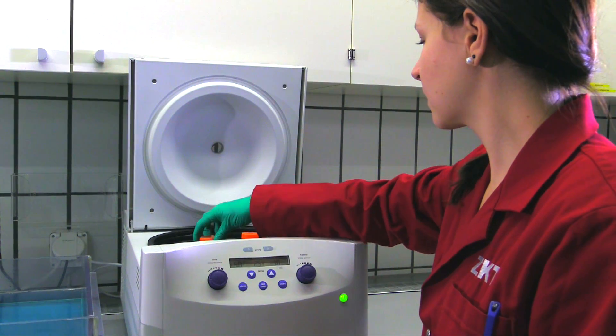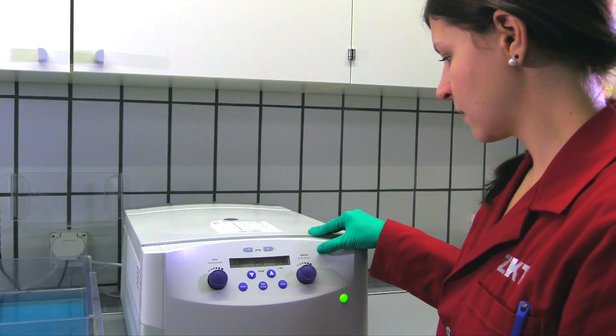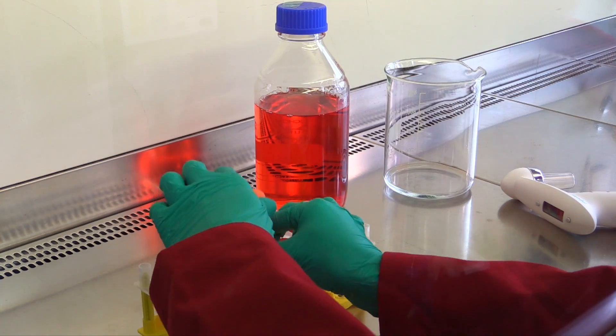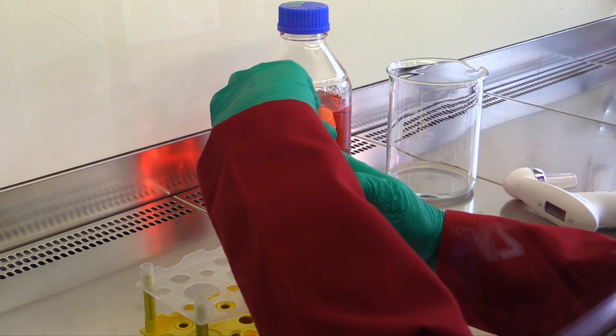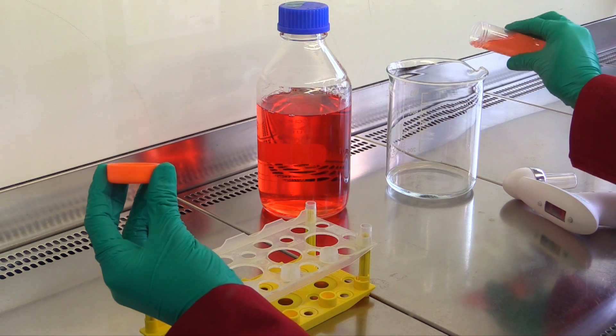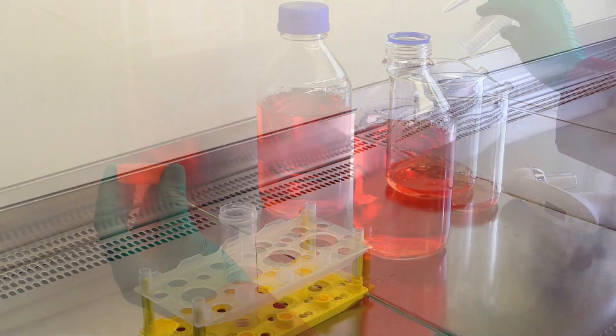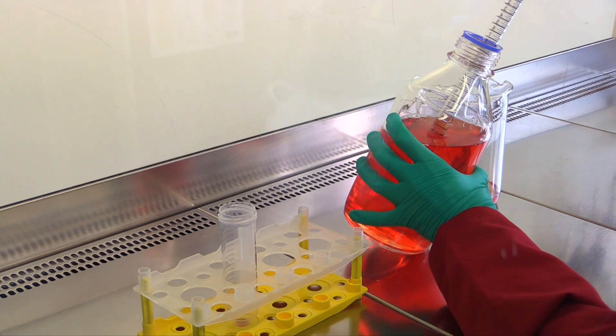The tubes are centrifuged for 5 minutes at 1000g and the supernatant is removed. Re-suspension in fresh culture medium then takes place.